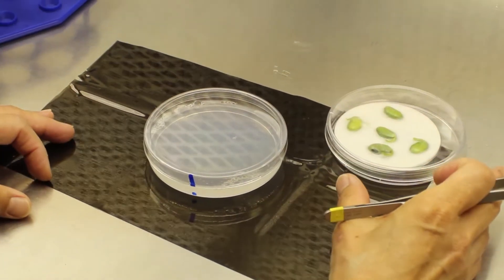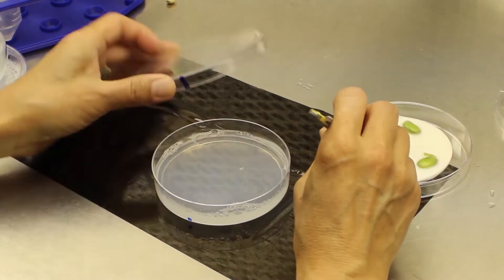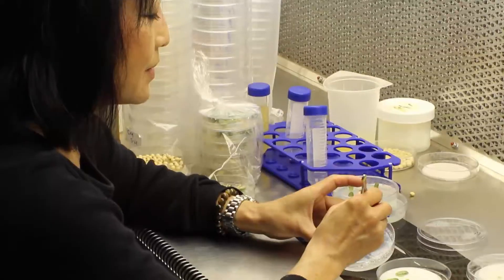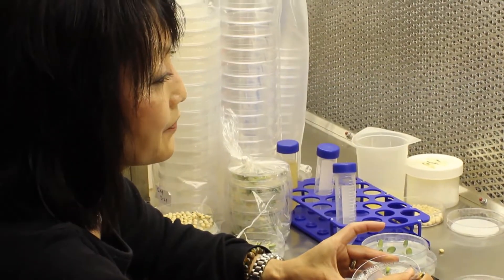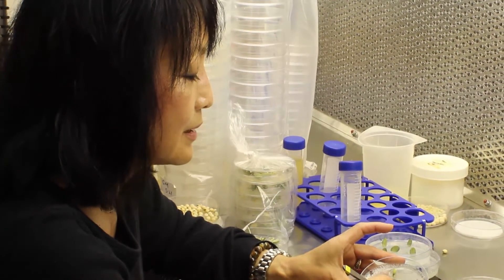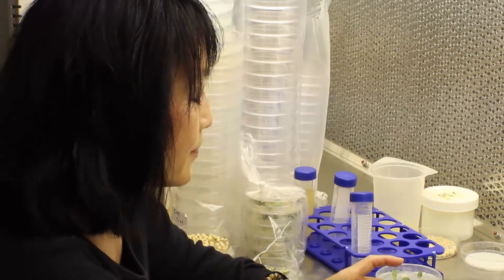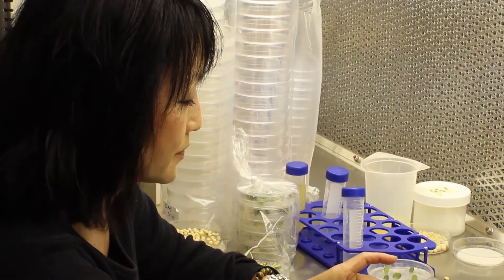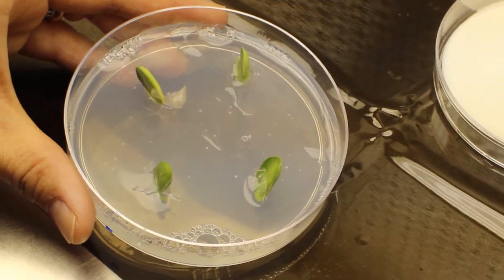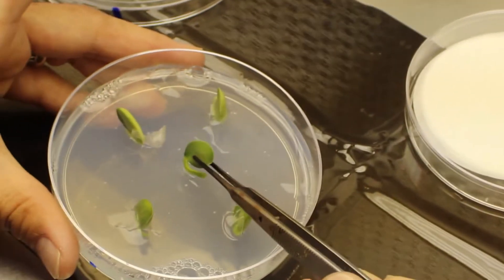After those three days of co-culture have passed, we now move these cotyledons to our selection plates. This media contains a chemical that would normally kill plant cells. We've introduced into these cotyledons, via the agrobacteria, a new gene that will allow them to grow despite that chemical. Also in this media is a hormone that will allow a single cell to grow into a whole new plant.